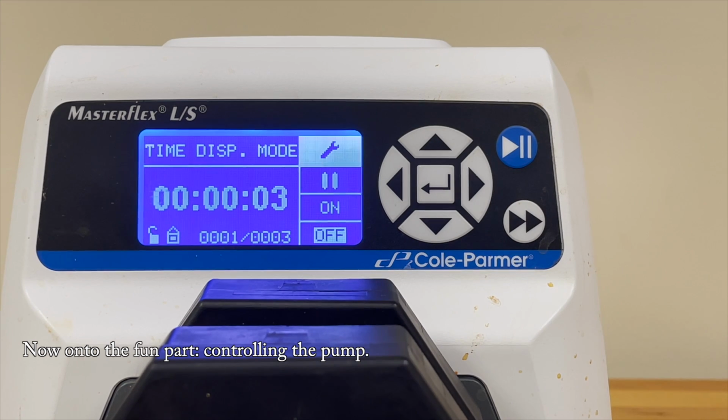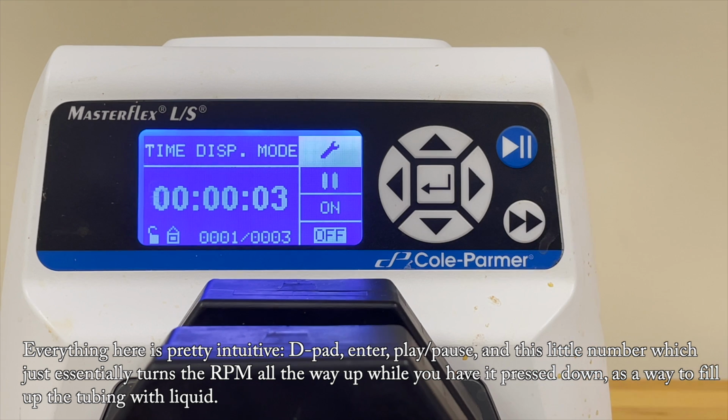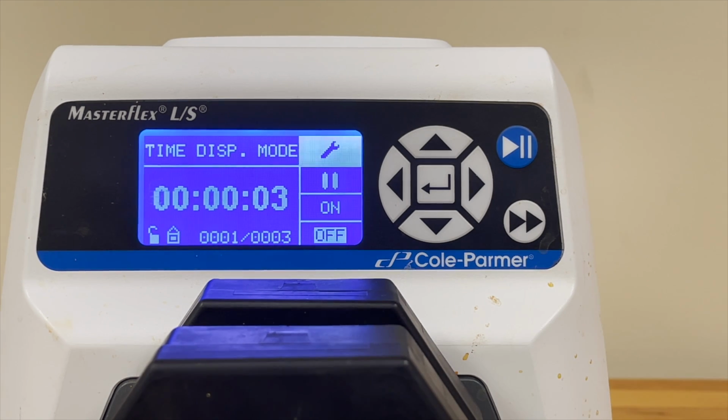Now on to the fun part, controlling the pump. Everything here is pretty intuitive. D-pad, enter, play, pause, and this little number which just essentially turns the RPM all the way up while you have it pressed down, as a way to fill up the tubing with liquid.